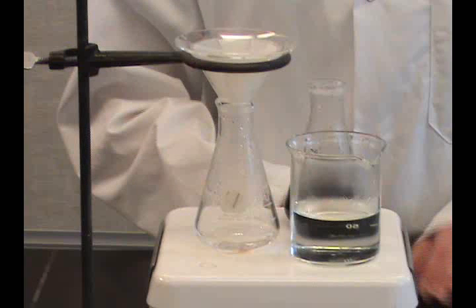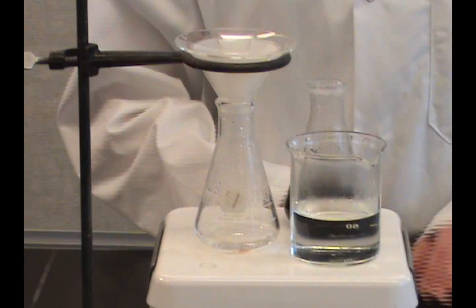Have a small amount of solvent in an Erlenmeyer flask heating on a hot plate. Place the funnel and ring above it with the filter paper in the funnel to warm them. Place a watch glass on top of the funnel. This helps keep the heat and decrease evaporation.